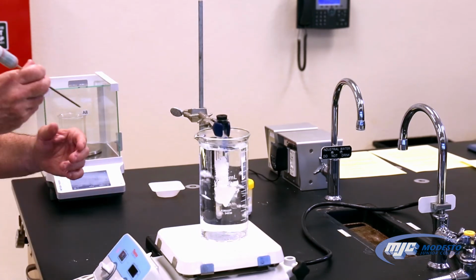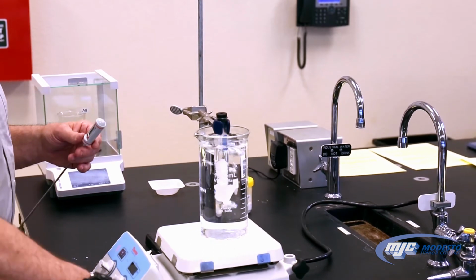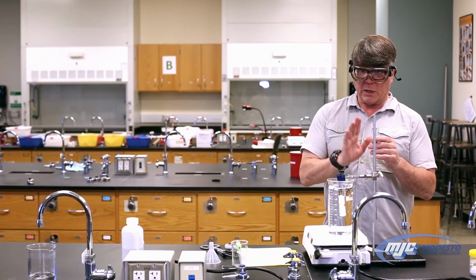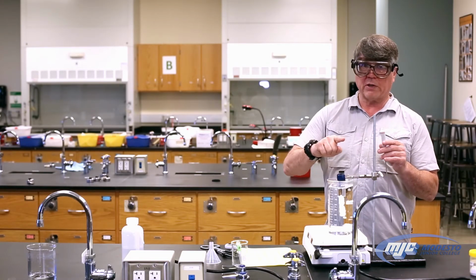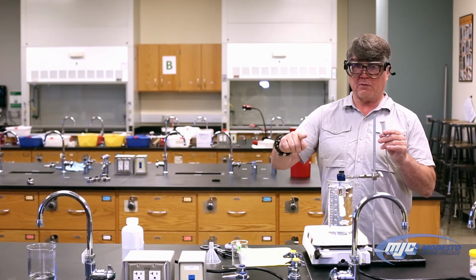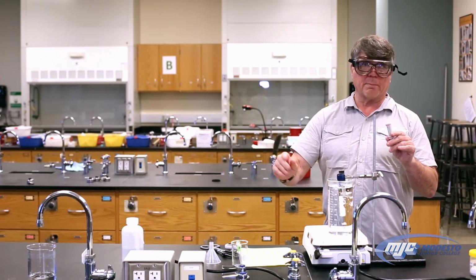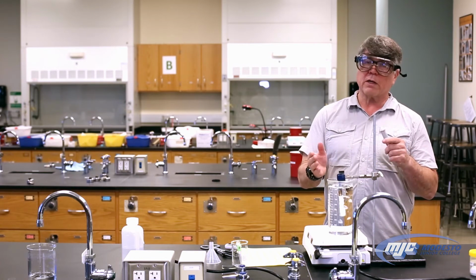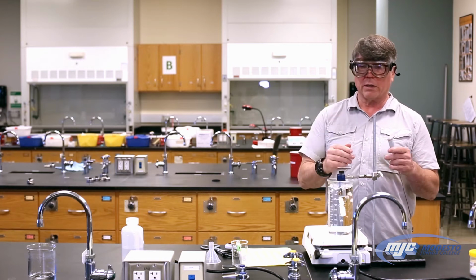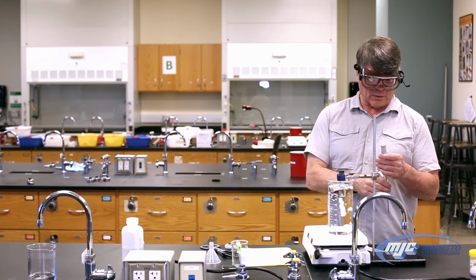And we're going to put the thermometer in there, and we're going to agitate it, and we're just going to record the temperature in this table every 10 seconds until it solidifies, and then the temperature stays the same and starts decreasing. Once we hit the decreasing part, we can stop. What happens is whenever anything is melting or freezing, or, by the way, boiling or condensing, the temperature always stays the same during that entire phase change. That's a good thing to know.